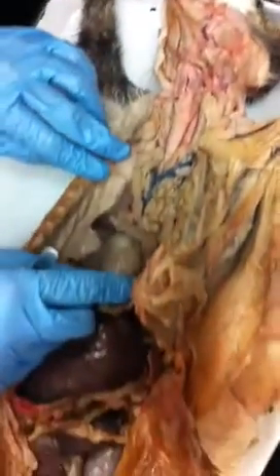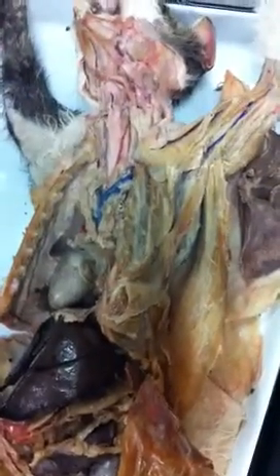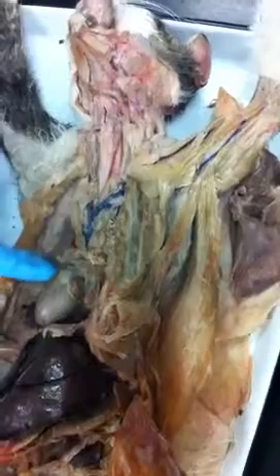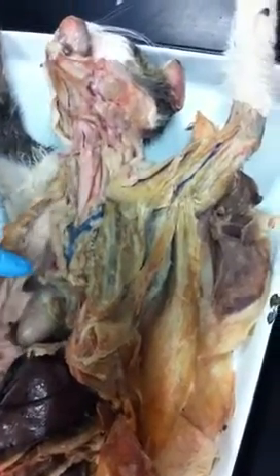What you don't have, though, is a thymus. Thymus is another gland that is in this area. I don't know if you had one and it's gone. Glandular tissue is pretty fragile, so you get a lot of people mucking in here and it gets all screwed up. But if this is an older cat, it wouldn't be there anyway, because as we age, it degenerates and goes away. So it might not have had one to begin with.